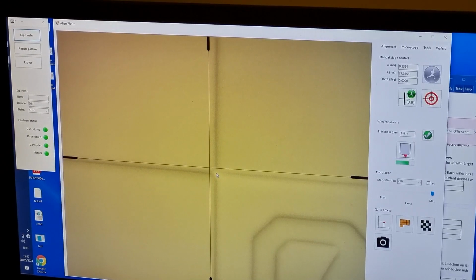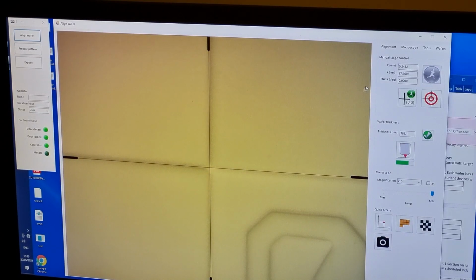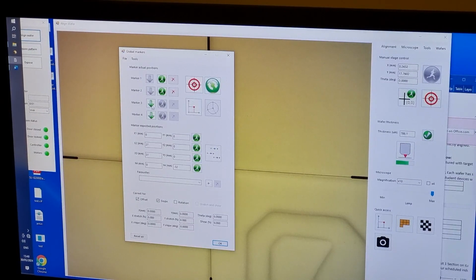Click the third down arrow to drop a marker under actual position and record the expected position as 0x and 18y. The program now has enough information to transform the data file coordinates into wafer space coordinates.